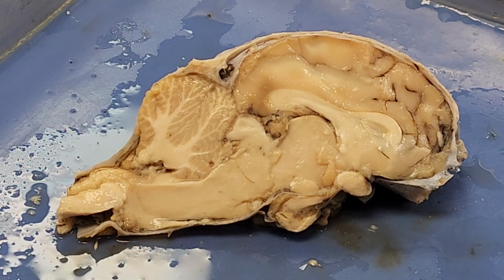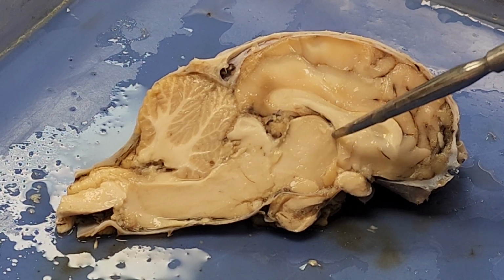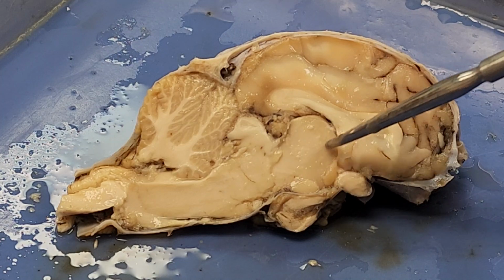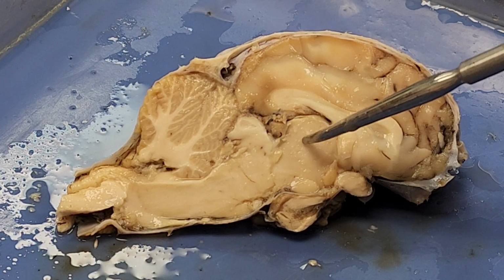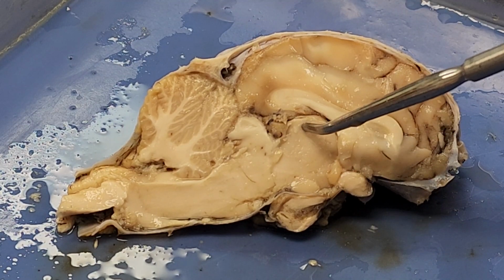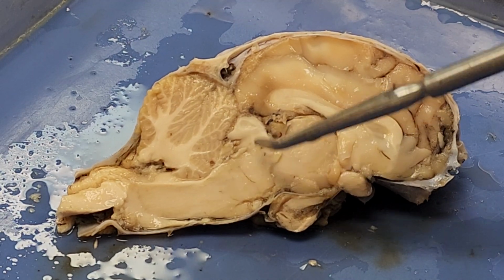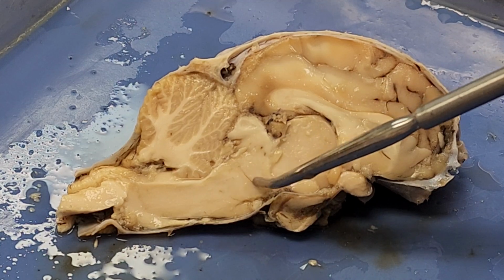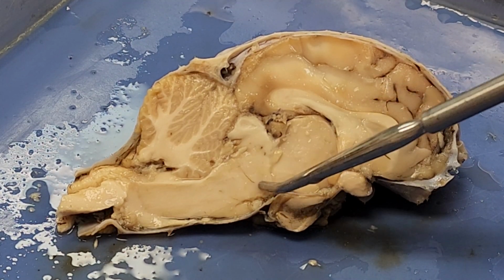So what I do to make this easier for me is I look for this little round structure. What you have to visualize here is this little circle. This is my thalamus. Thalamus, of course, is the gateway for sensory. The area under my thalamus down here is going to be my hypothalamus. And then this part and this part are my midbrain. So we go thalamus, hypothalamus, midbrain.